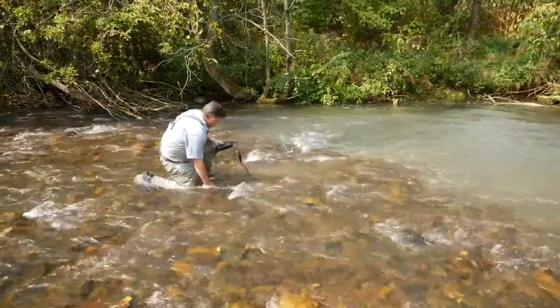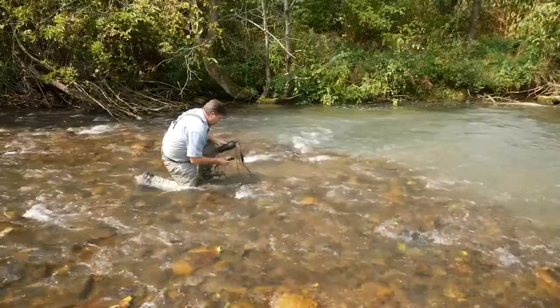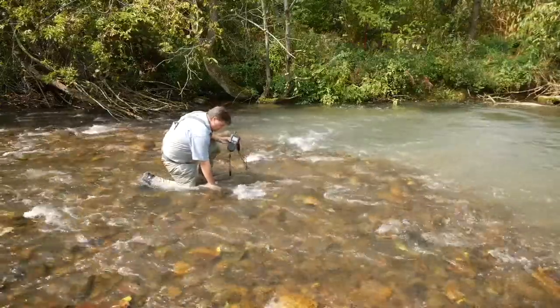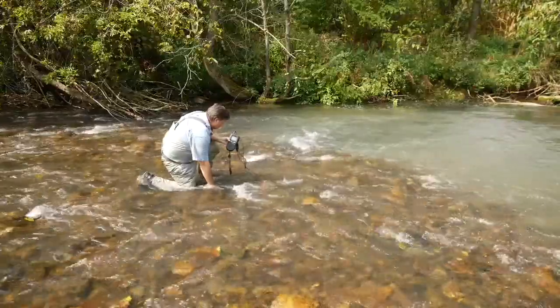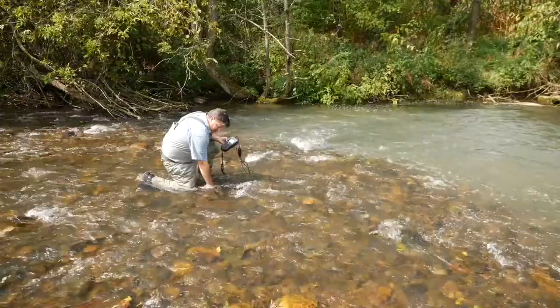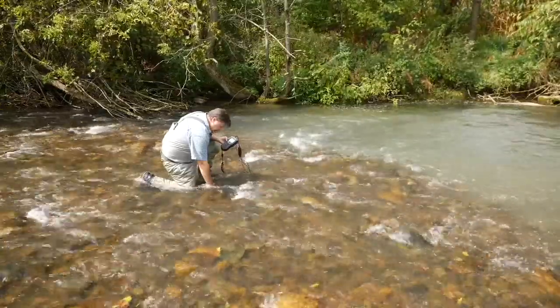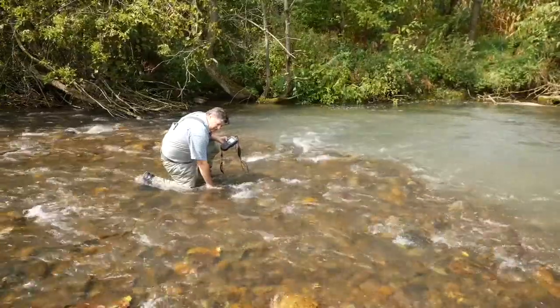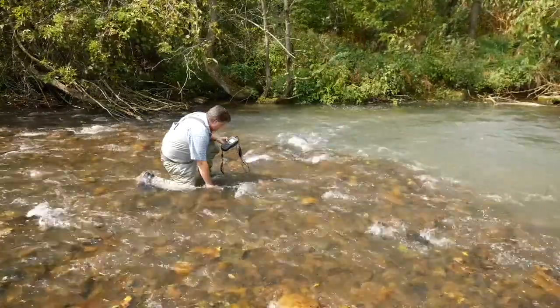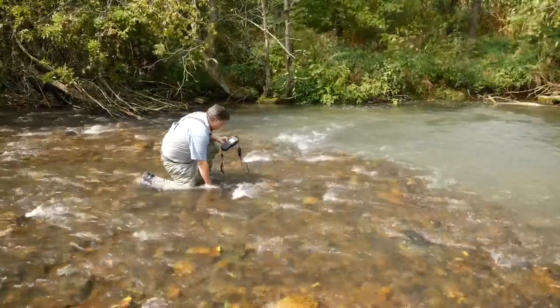So I'm going to put the probe in the water and press the green button for read, and it's going to start taking measurements. Like the riffle section above, this section is only about 6 to 8 inches deep, and I'm measuring the oxygen concentration about 2/3 of the way to the bottom, so about 2 inches off the bottom of the pebble bed.